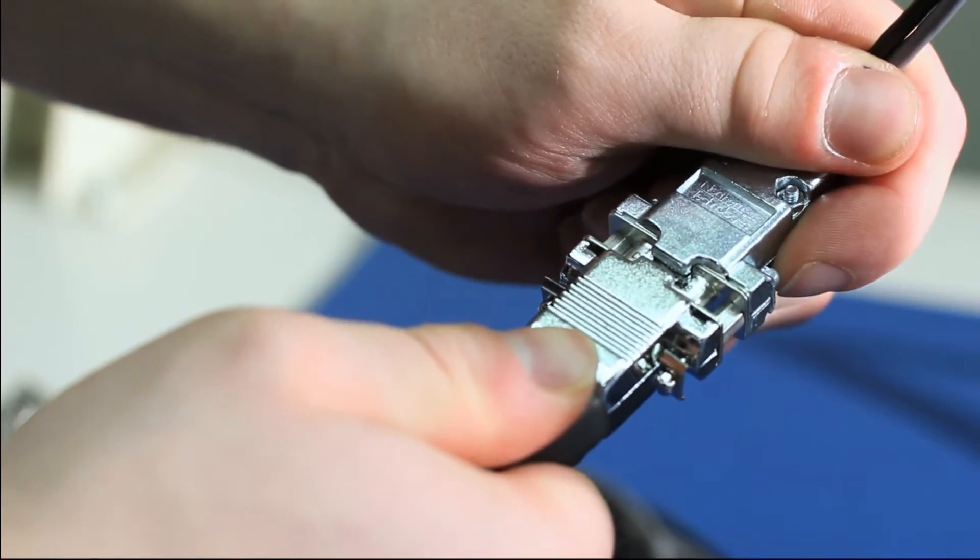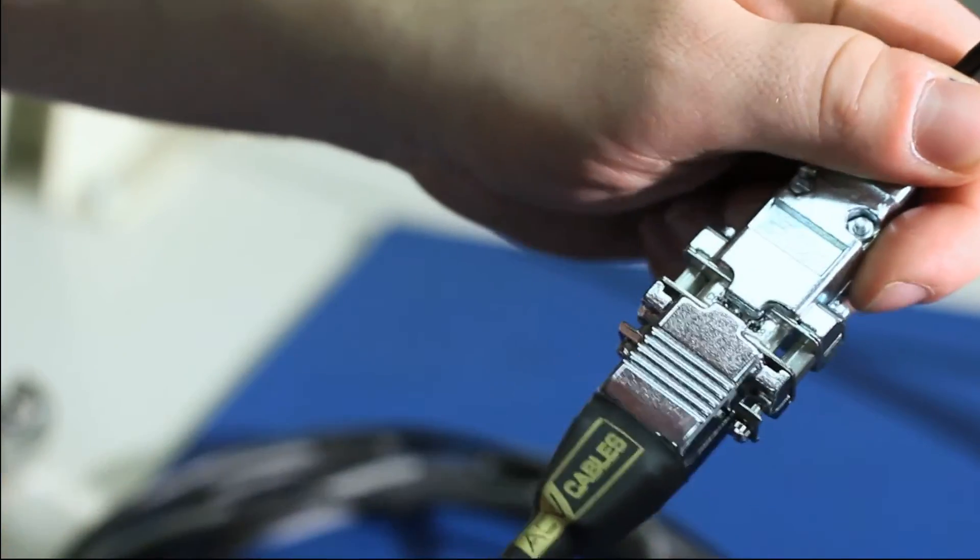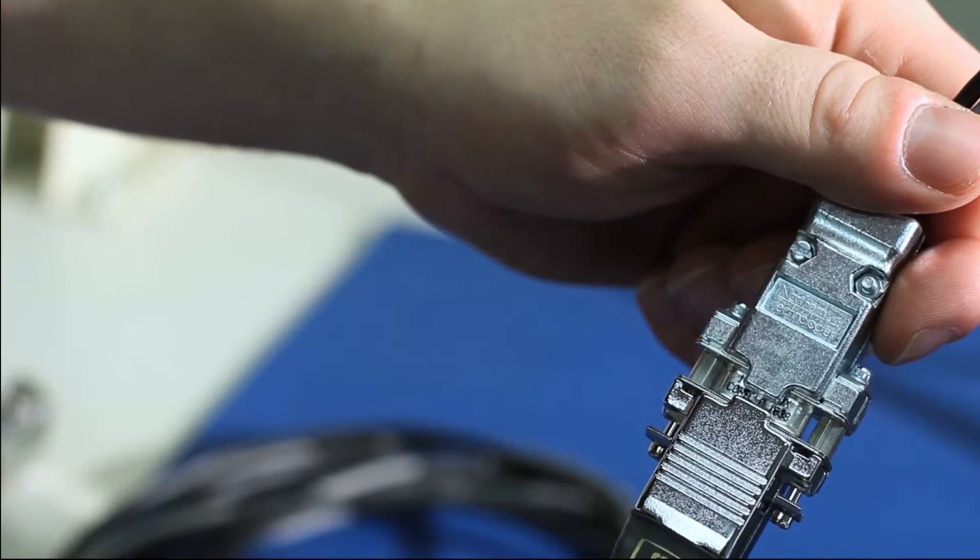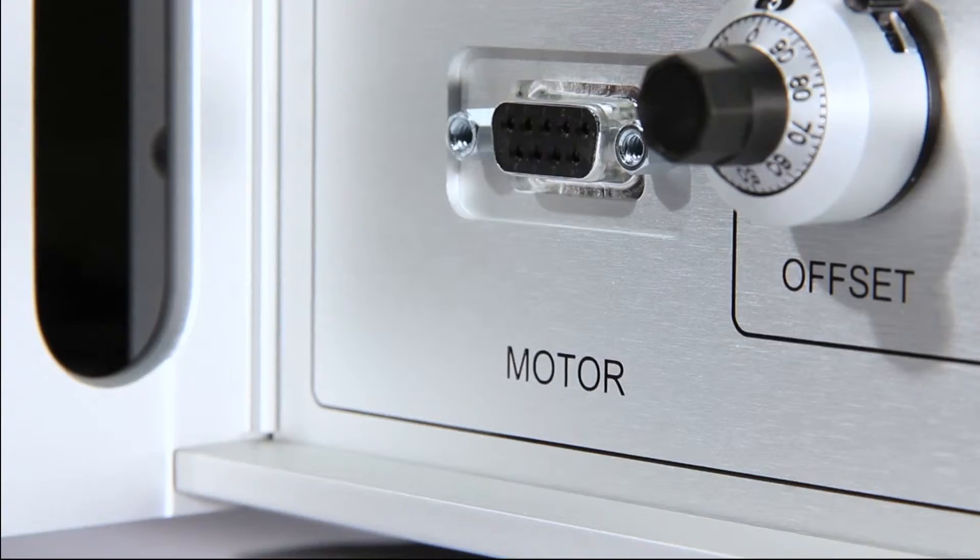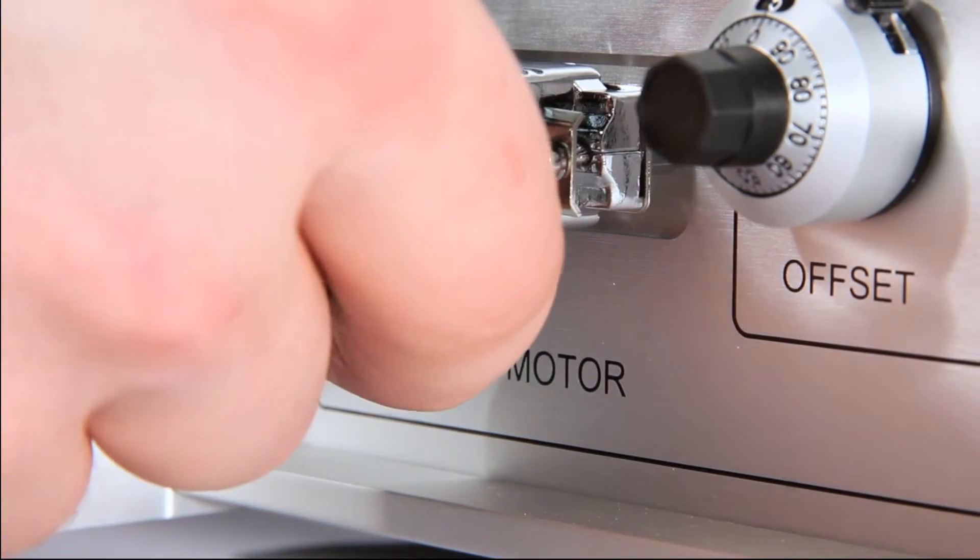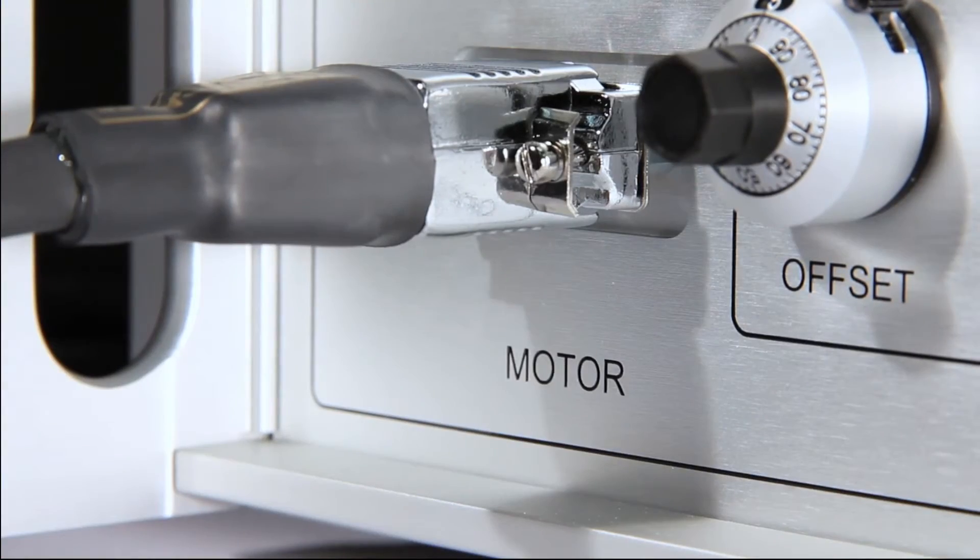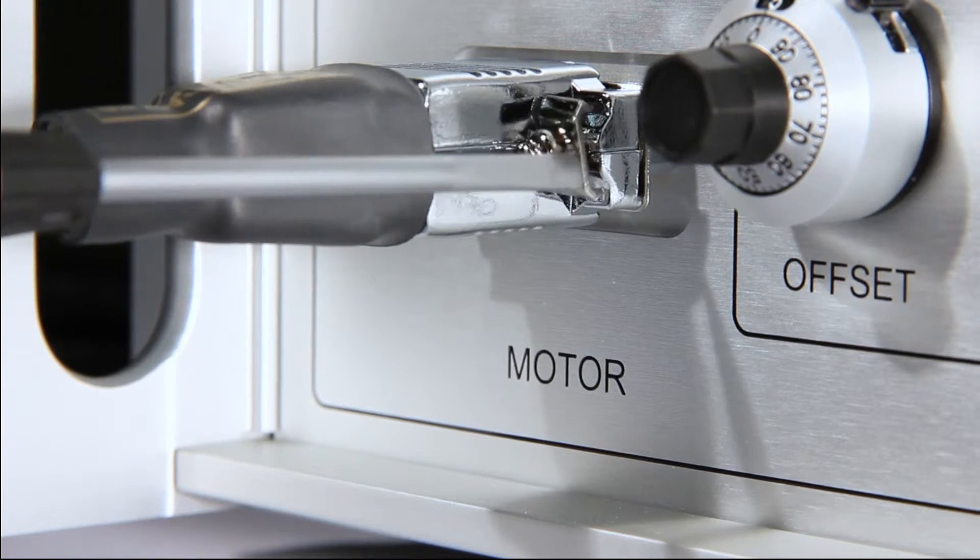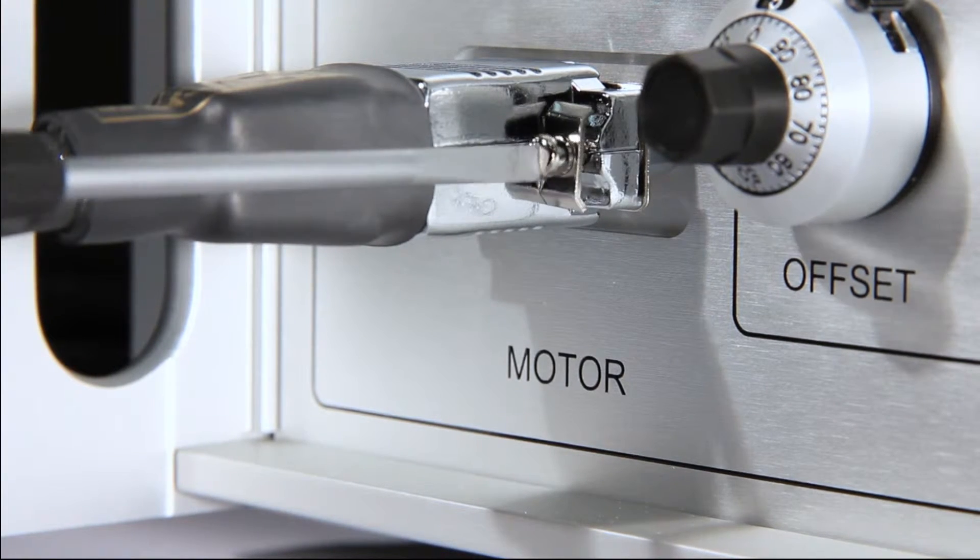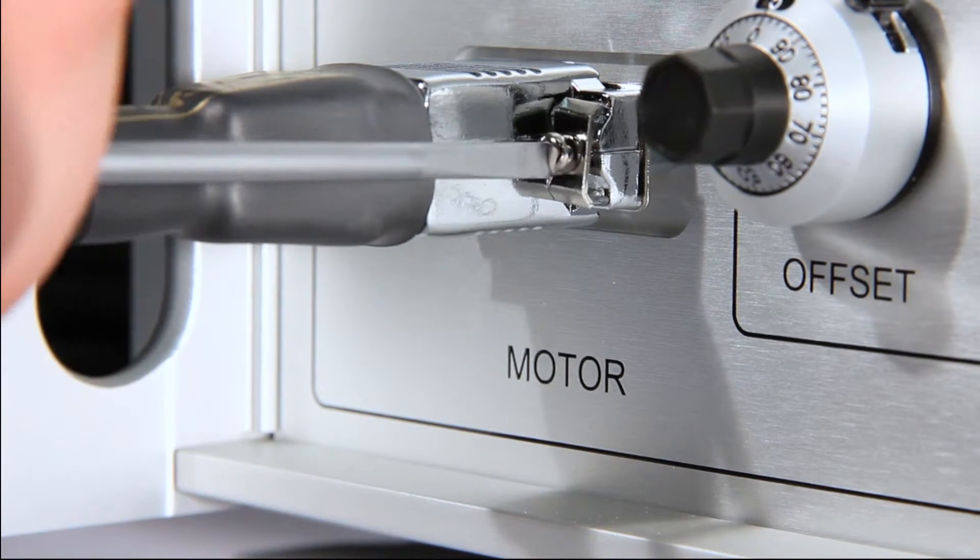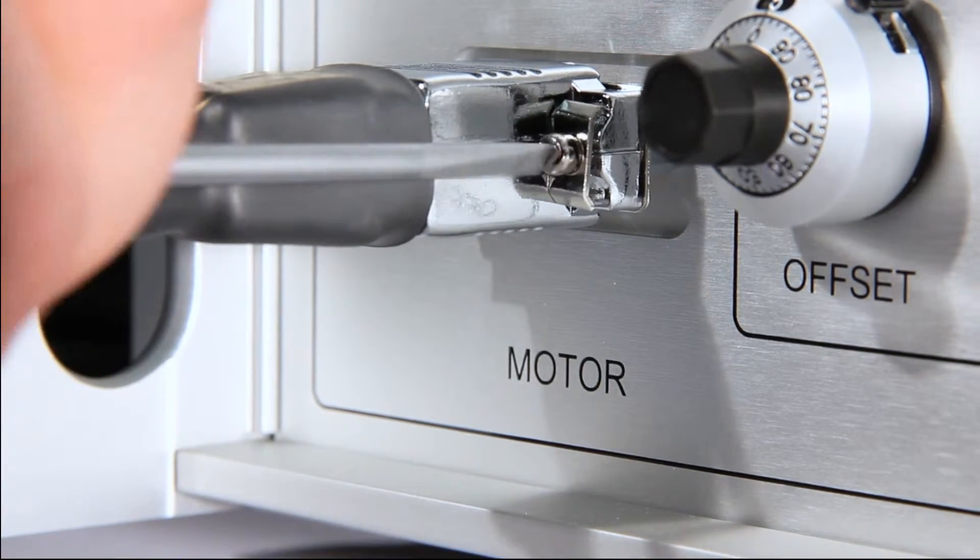Connect the motor cable to the pigtail of the motor. Then connect the other end of the cable to the input labeled motor. Be sure to tighten up the screws at the connectors with a slotted screwdriver.